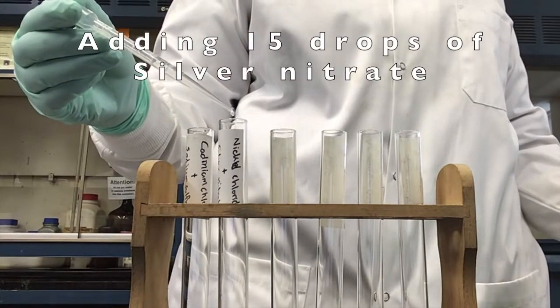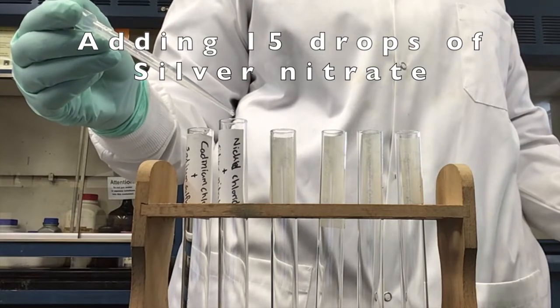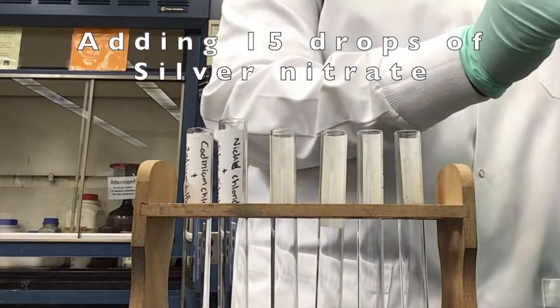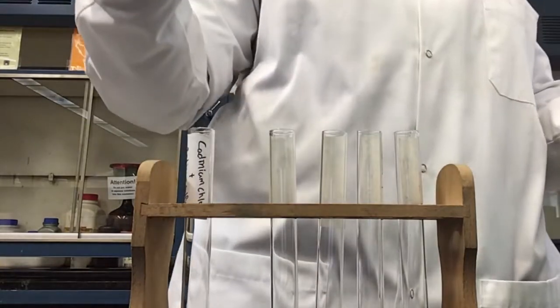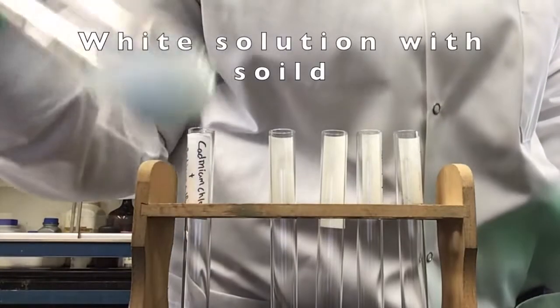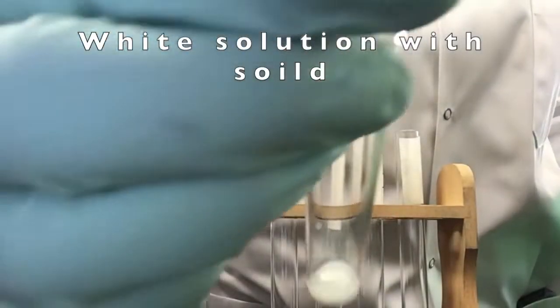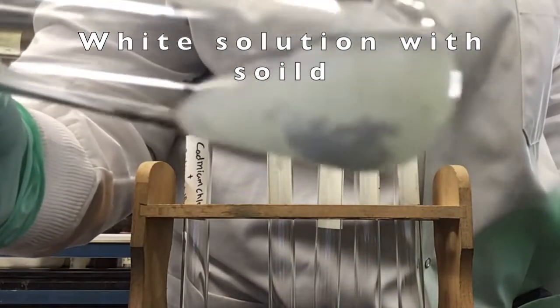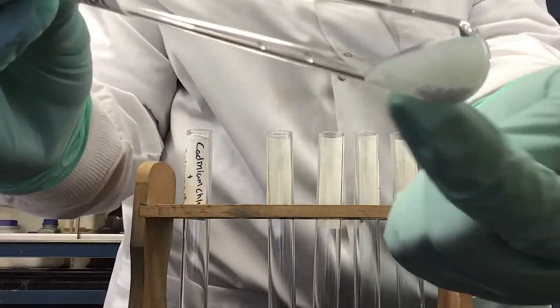Now we're going to add 15 drops of silver nitrate to our nickel chloride. Nickel chloride and silver nitrate give us a white precipitate. It's pretty thick. It's forming at the bottom of the tube, as you can see.